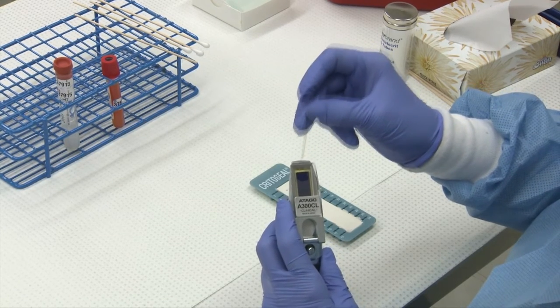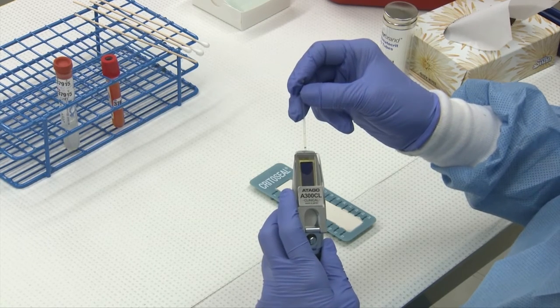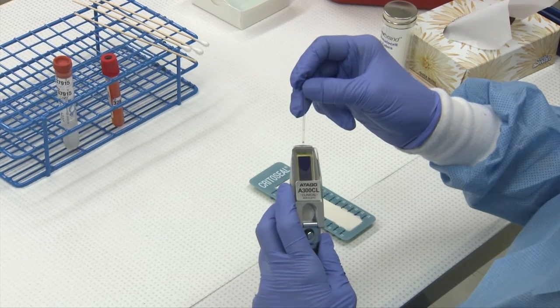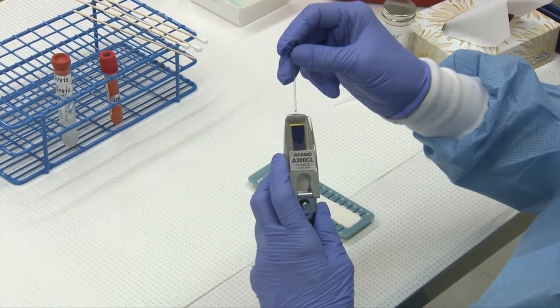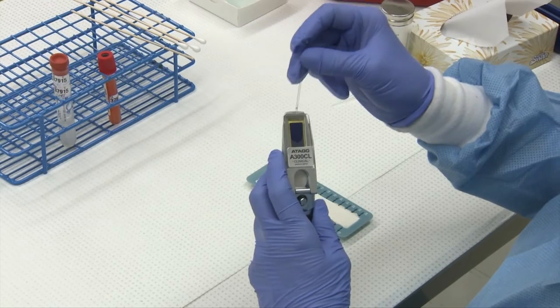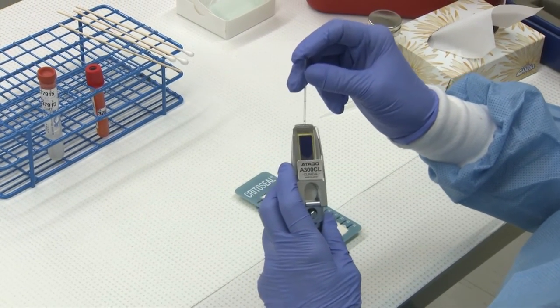So flood your refractometer. You want to make sure you have enough sample to make sure you have a large dark area otherwise you won't be able to read your results. Sometimes you might need to use two tubes of plasma or fluid, whatever the case may be.